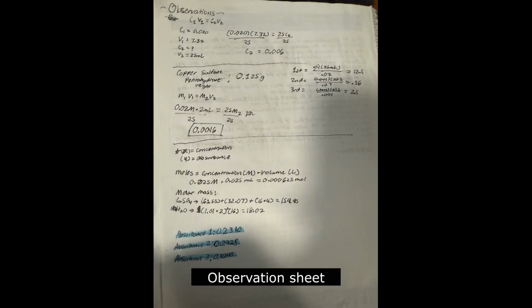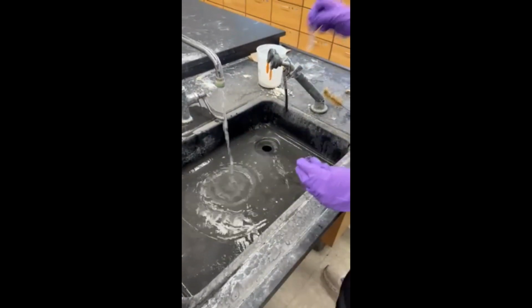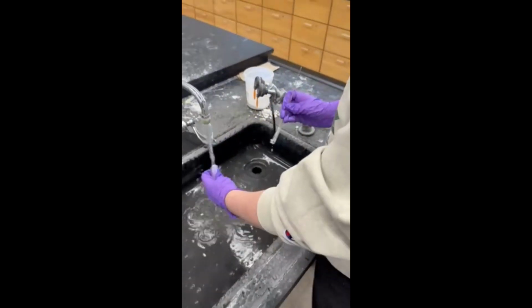The first absorbance was 0.2310, the second absorbance was 0.2425, and the third absorbance was 0.1045. Now that the experiment is done, make sure you clean every piece of equipment that you used with soap and water.